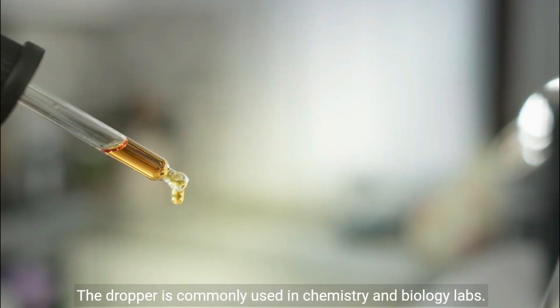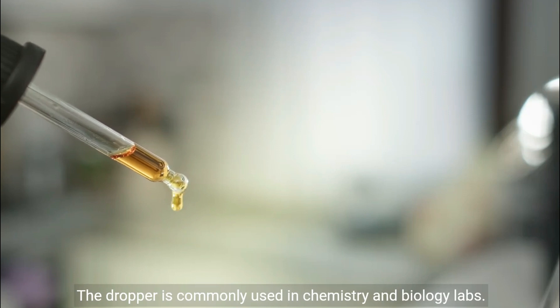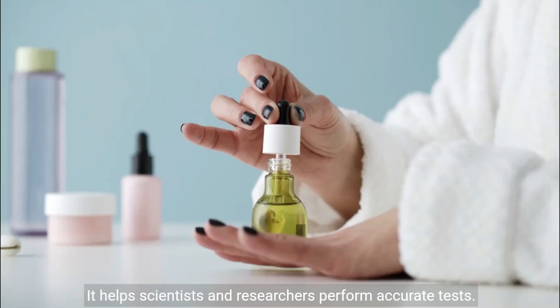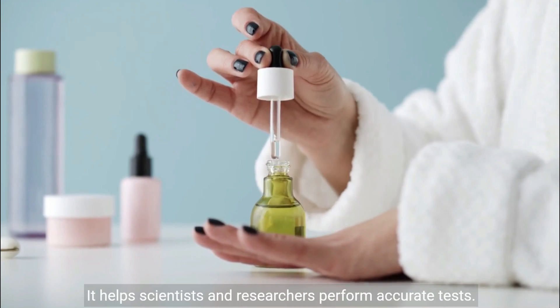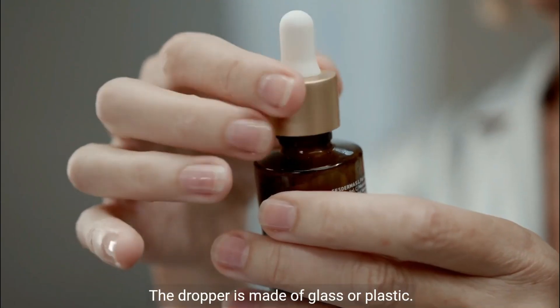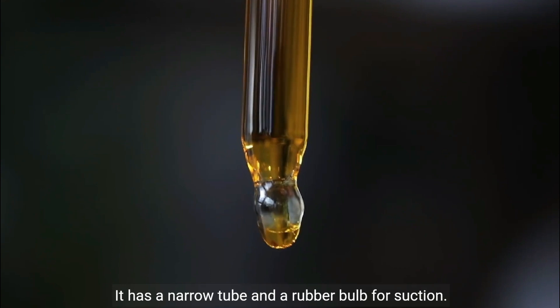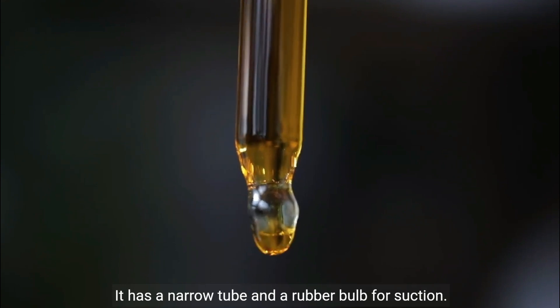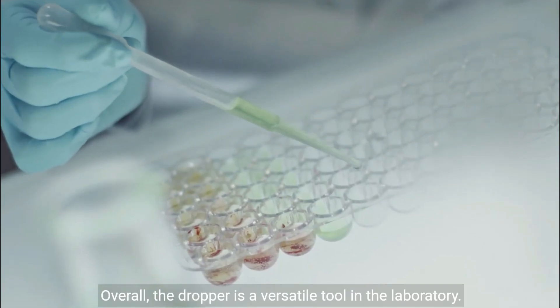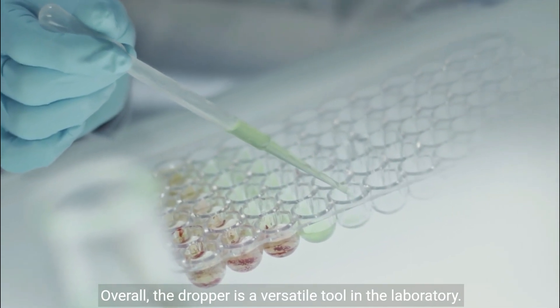The dropper is commonly used in chemistry and biology labs. It helps scientists and researchers perform accurate tests. The dropper is made of glass or plastic. It has a narrow tube and a rubber bulb for suction. Overall, the dropper is a versatile tool in the laboratory.